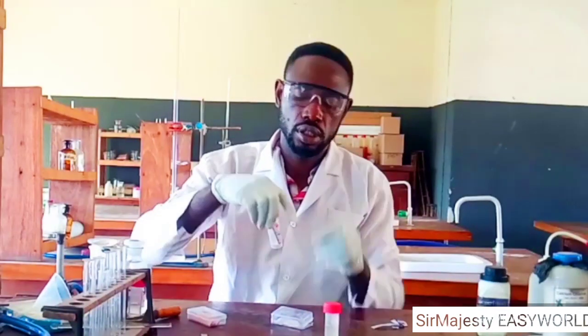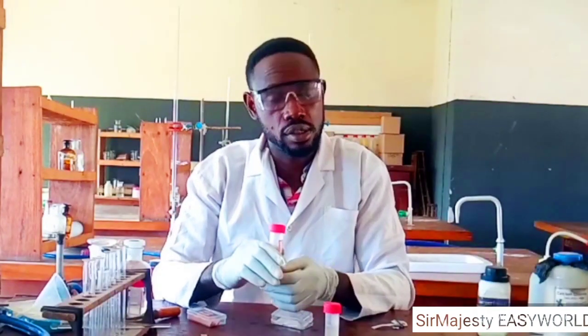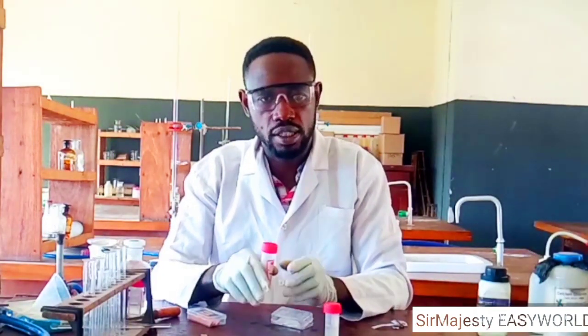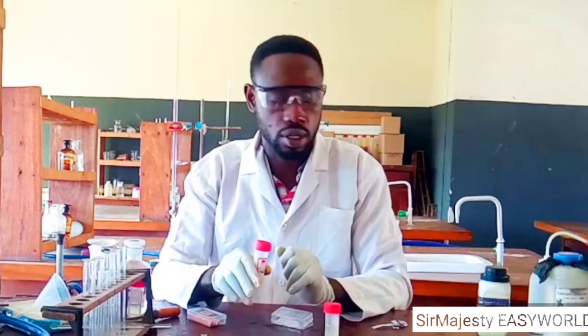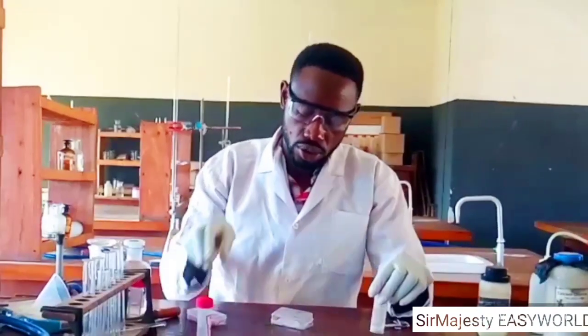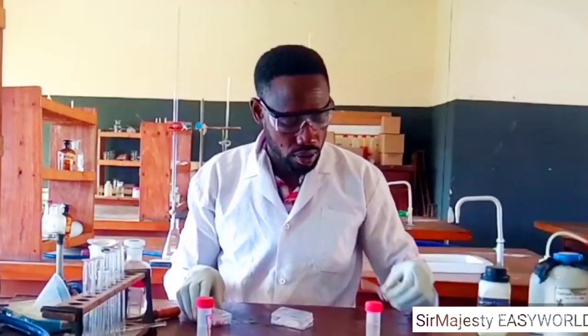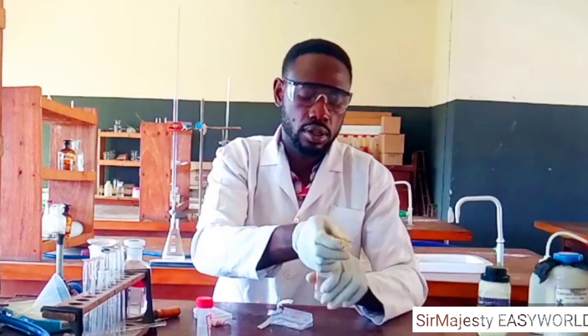Your inference should be that L, or whatever you might decide to label it, is acidic. Remember the test is test L with litmus. Observation: it turns blue litmus paper red. Your inference, that's your conclusion, should be that L is an acidic solution. So we come over here for calcium chloride, supposed to actually behave as an acidic solution also. Let's check because of the HCl there.